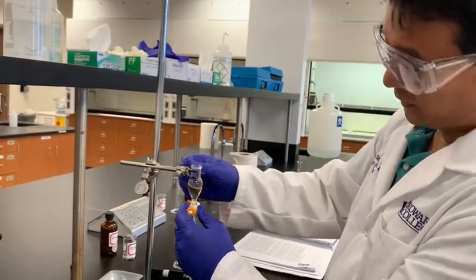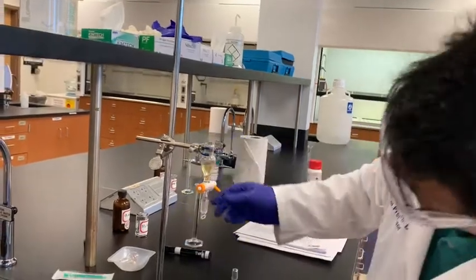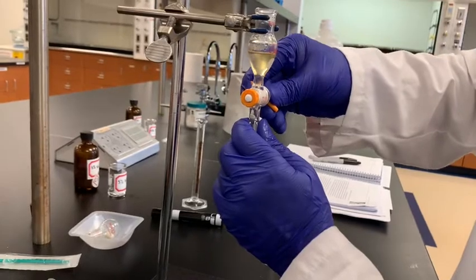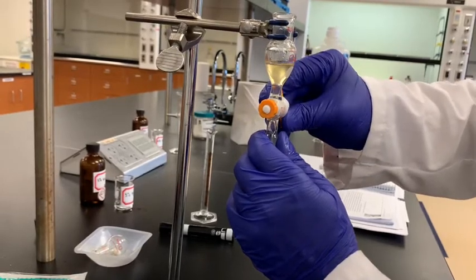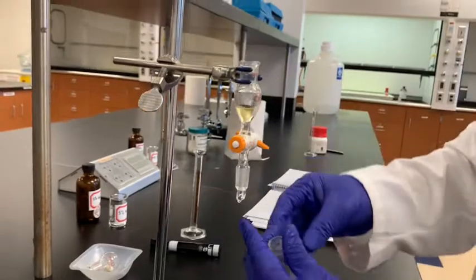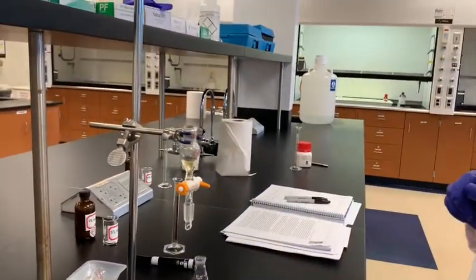Okay. Now it's much better. Yeah, a little bit I can draw there since there is one extra amount. Okay, that's good. Yes. So this is where I have my product there.